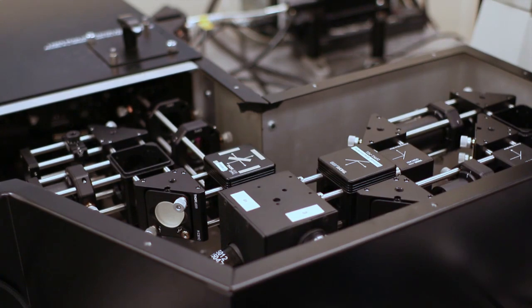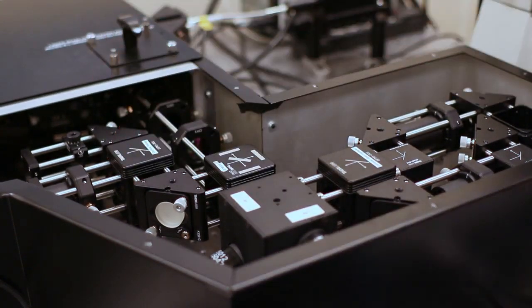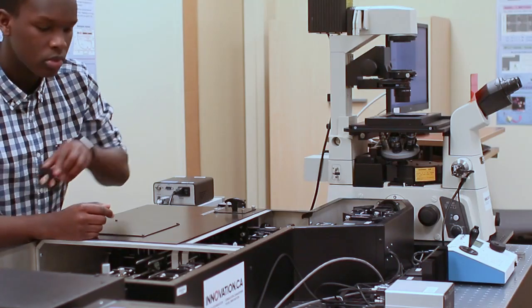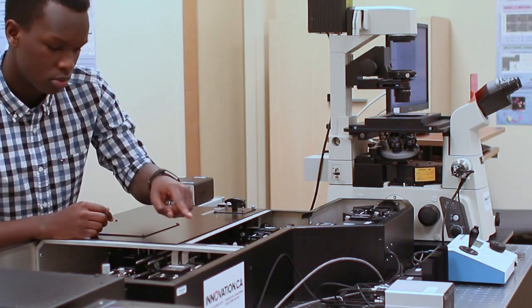Continuing the path toward the detector, place the confocal pinhole optical cube in the right position to direct the light through the visible light detection path and, following this path, place the confocal spectrometer optical cube in the appropriate position so that the emitted light reaches the detector.